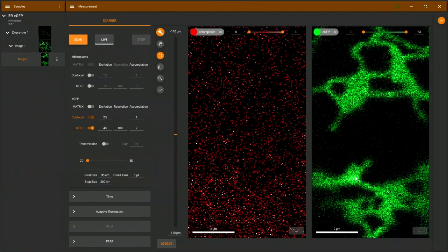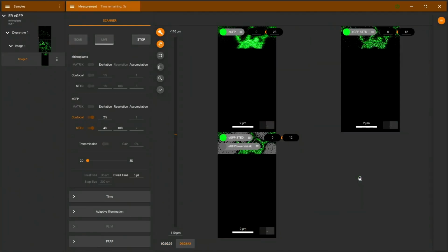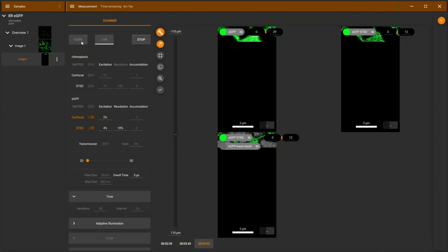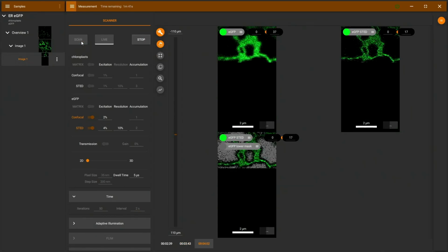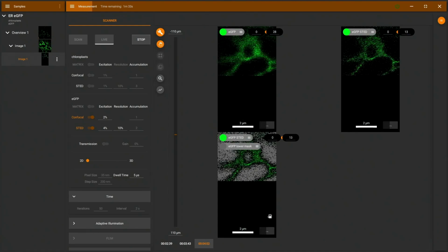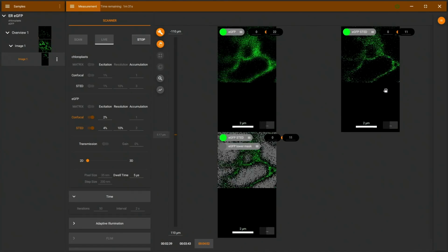Now, if I scan here, we will get a confocal and also STED images. And we also see an overlay here. I will now activate the timer, basically doing 50 frames with 2 seconds per frame. Pressing scan, we can see the image being recorded. I think it's moving slightly up here, so I'll refocus a little bit.